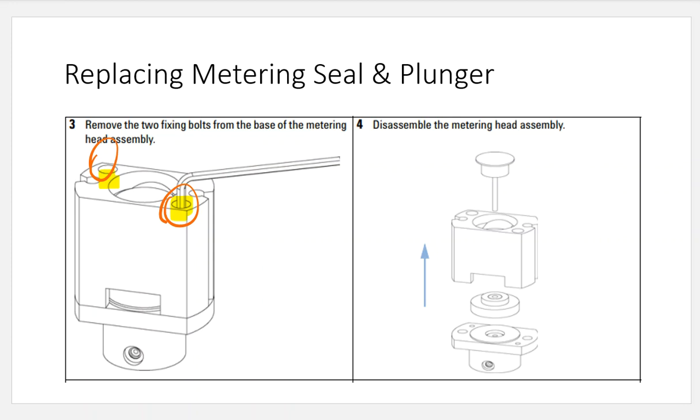By loosening the two things up, I can then separate the two compartments from each other. I saw that with an analytical pump head. I'm seeing it here because, in a sense, this really is a pump head too at the same time. On the inside, surprise, surprise, I get the same thing. I see this kind of guard that's going to be located. I saw that in the pump, and I saw a piston that's also going to be in there. I saw that from the pump as well.